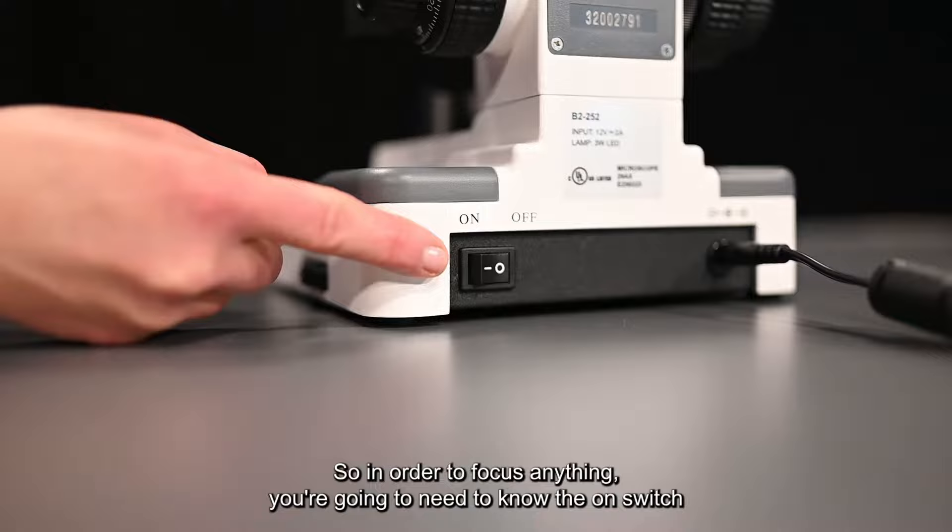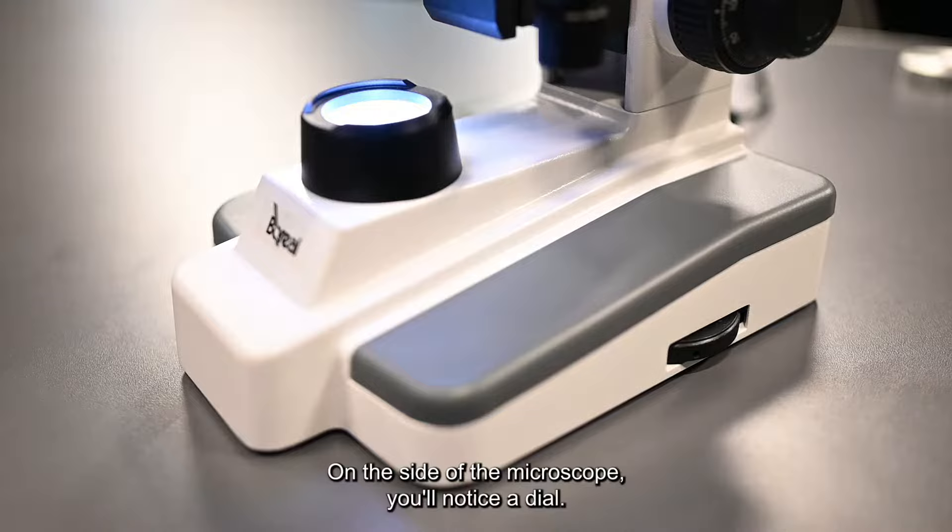In order to focus anything you're going to need to know the on switch because you need light. Turn it on.